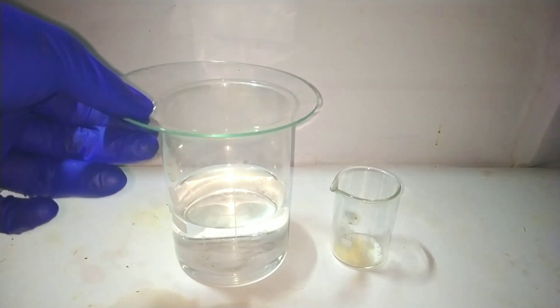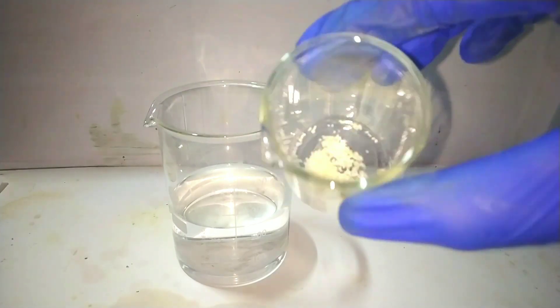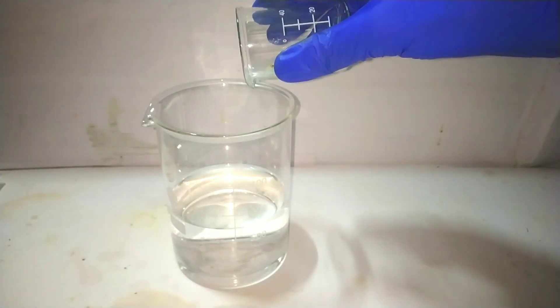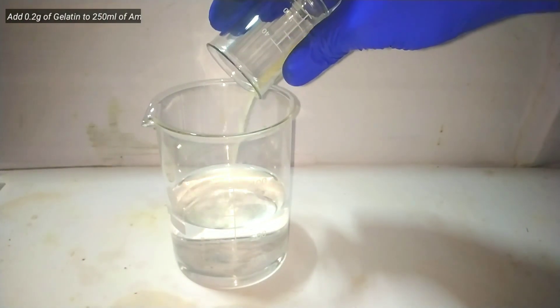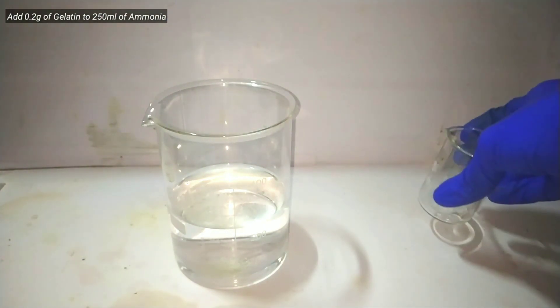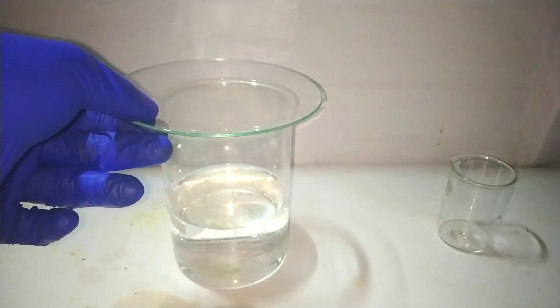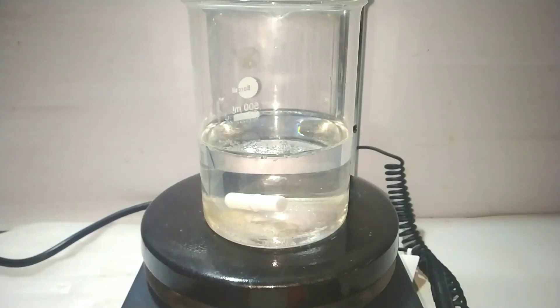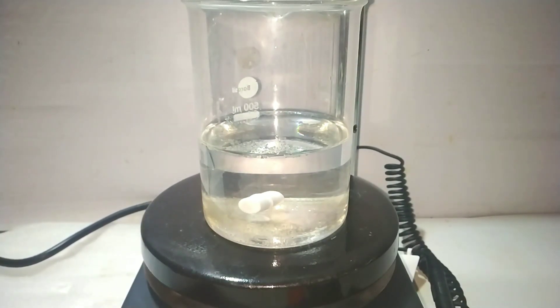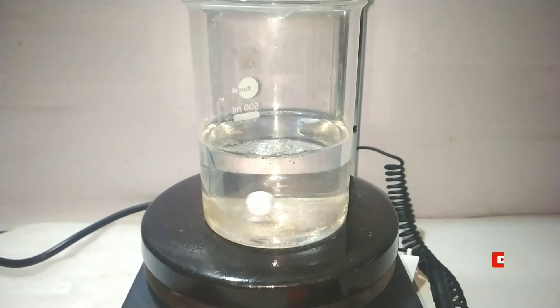Start by taking 200 mg of unflavored gelatin and add it into 250 ml of 25% ammonia. Place the beaker on a hot plate stirrer and stir to dissolve the gelatin in the ammonia.